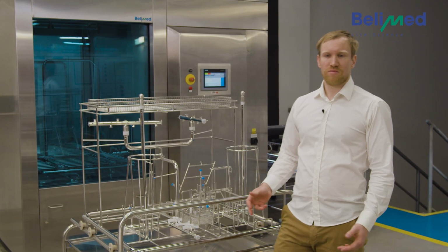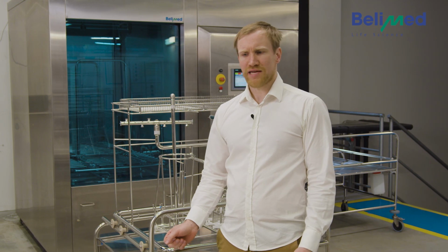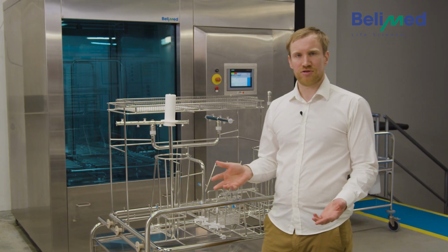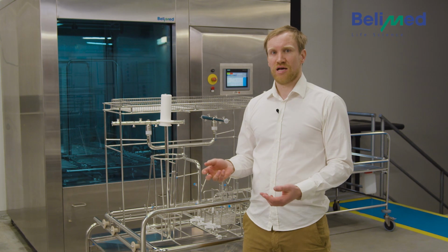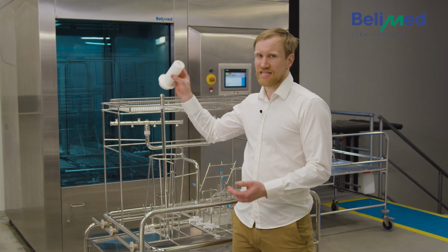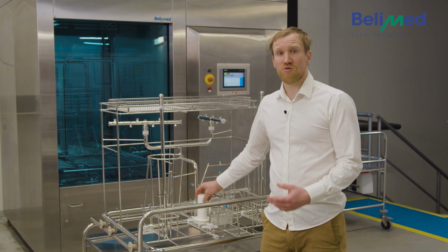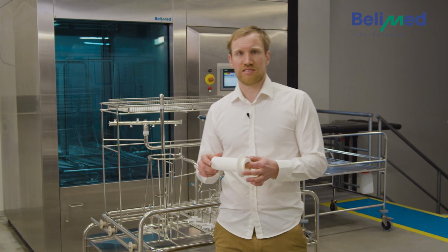It all starts with the gathering of the wash goods and placing them on the rack. But what happens if you place a part on the wrong spot? The best cleaning detergent, the best cleaning process doesn't help if a part is placed on the wrong spot or is missing at all. So it's absolutely important that each wash good is placed on the right spot, because only then can we assure that the cleaning process will be successful.